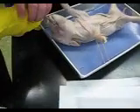Go ahead. Cut! Cut! To where? Cut! These work better — more leverage. Right here? Yeah. Cut all the way down. Woo! Snap!